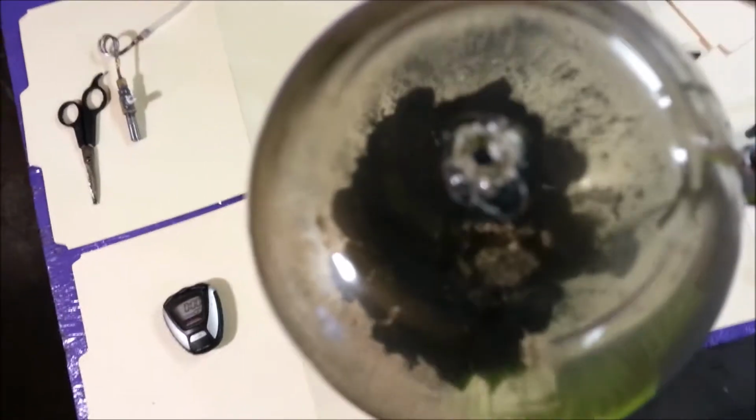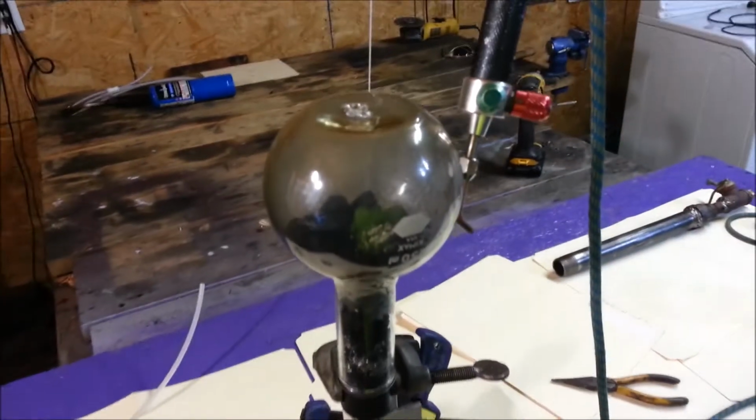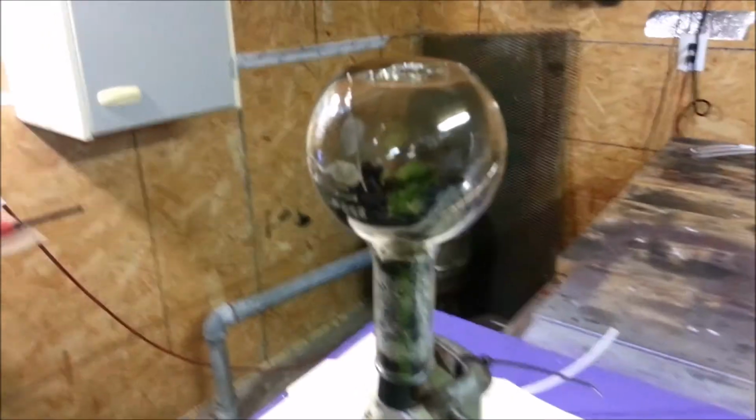So, we're getting nowhere fast with that. I have to anneal this thing real quick before I lose it. Gotta take all this down. So, I think I'm going to resume this in the morning. Well, it cracked. I'm trying to anneal it now, best I can. I did try to mend the cracks. But for the most part, sorry, complete failure. The bulb is cracked.